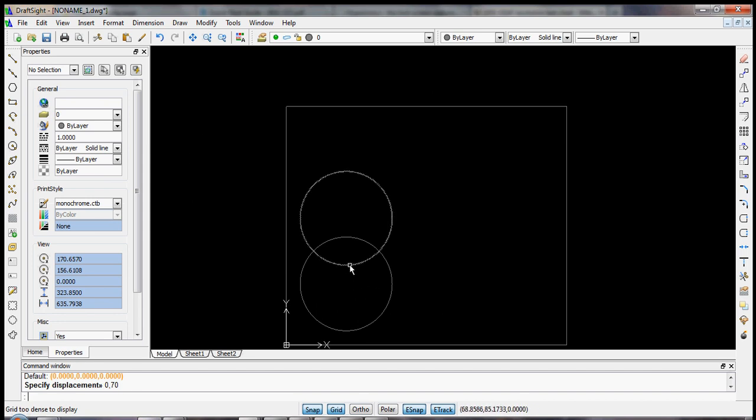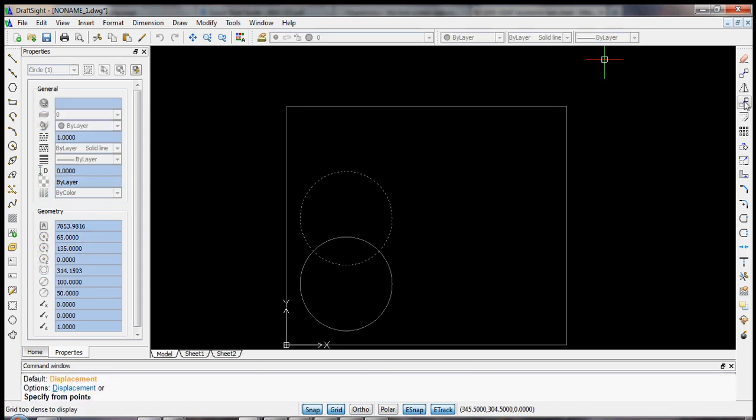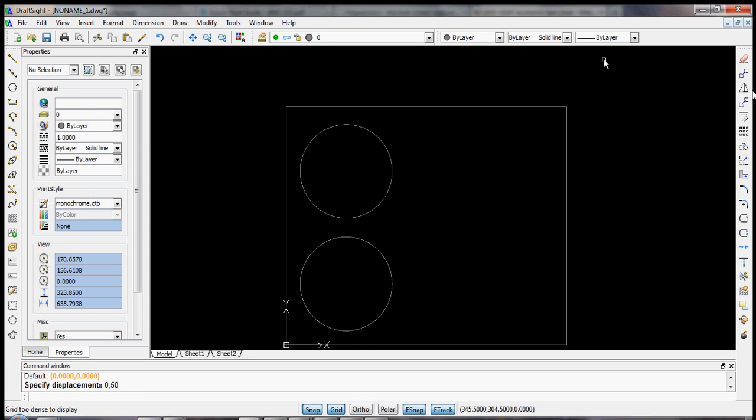I clearly made a mistake here. I actually should have displaced it by 100 millimeters plus 20. So let's move it up 50 more millimeters. We can click it, we can type move or select the move icon, and here we'll do displacement again, D, enter, 0, 50. Okay, that's what I intended to do in the first place.